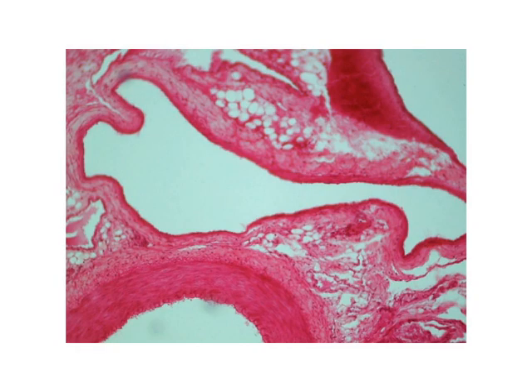Here, we zoomed in and you see again the vein, much thinner walled here. And they don't have the internal or external elastic membranes in it. So this is all I'm going to do for the histology of blood vessels.